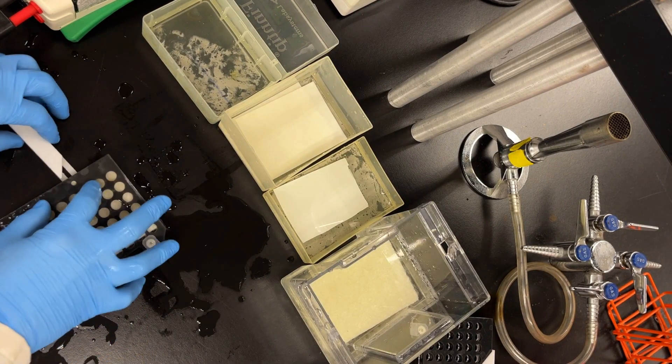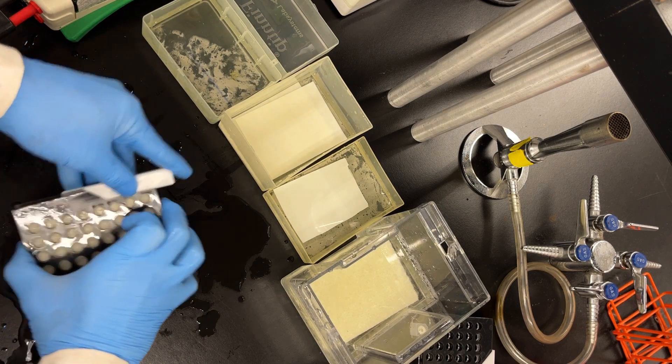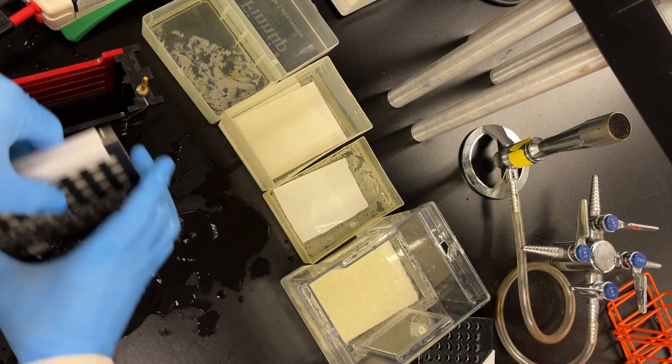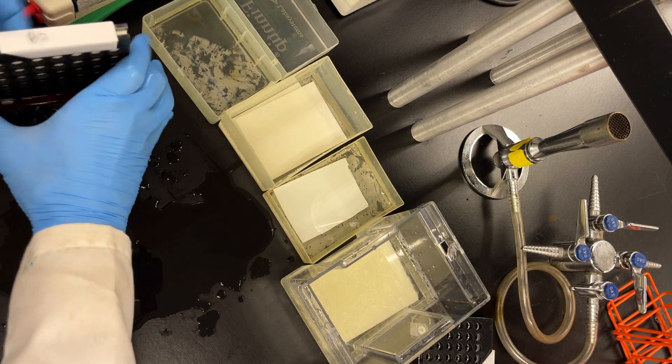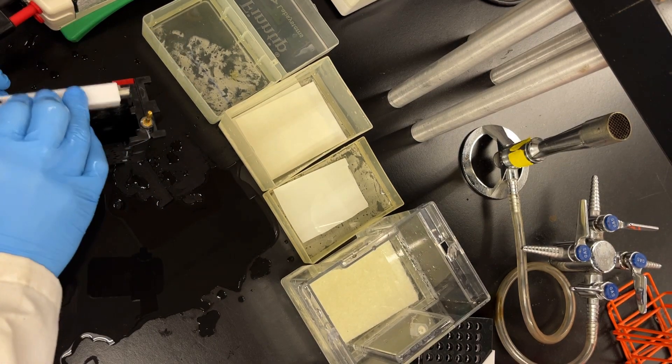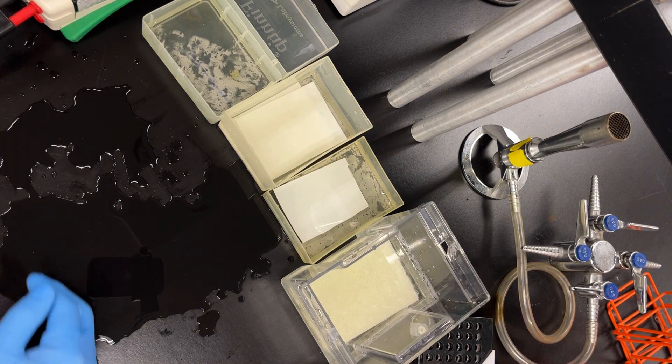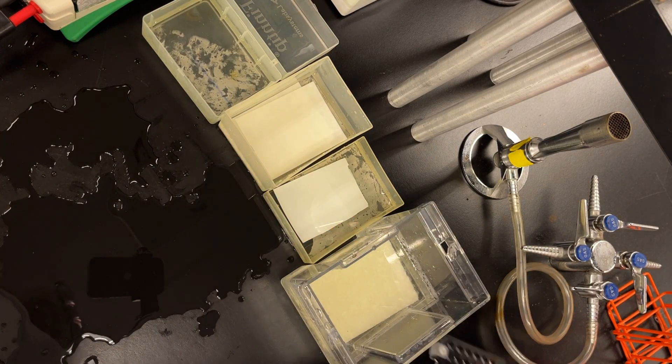It'll be a really tight squeeze. So squeeze nice and tight. Close up our cassette. And this goes into our transfer apparatus. And then this will also be a tight squeeze. This was actually really hard to do while I was looking at my camera. But there we go. That's one done. Let's repeat it for the second gel.